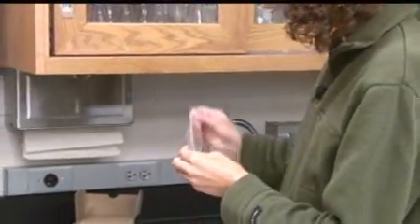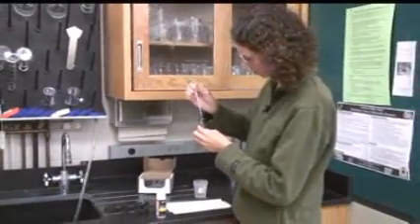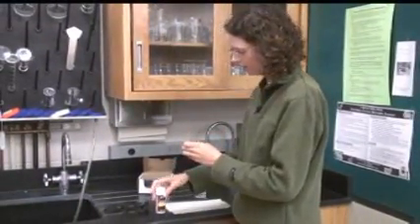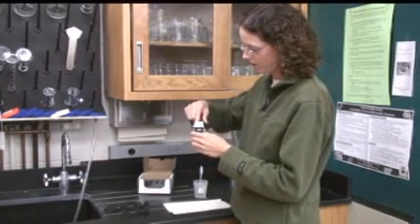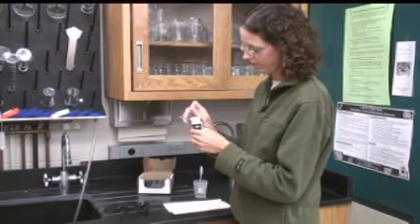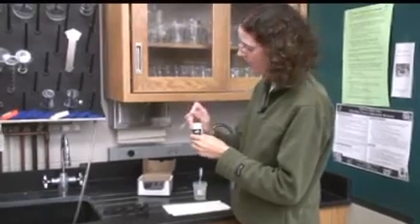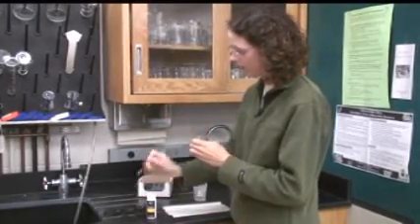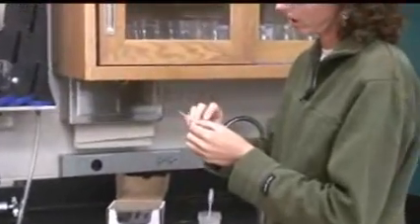So you fill it to the line. After checking the expiration date on your bottle, remove one of the strips and close your bottle again. These strips are slightly different in that there are two pads — one of which contains a reagent and then the top one, which is your color change.